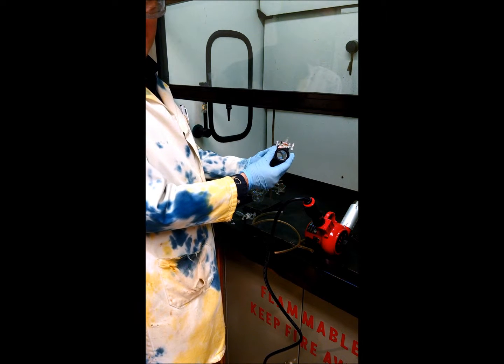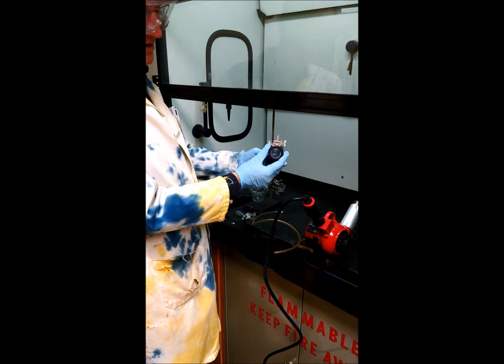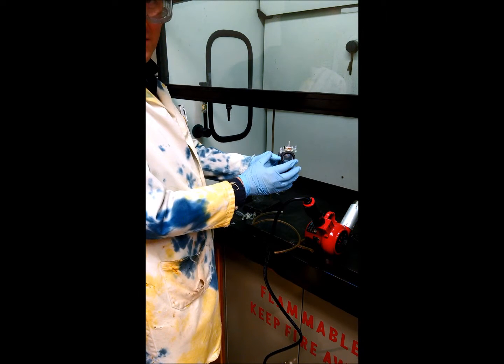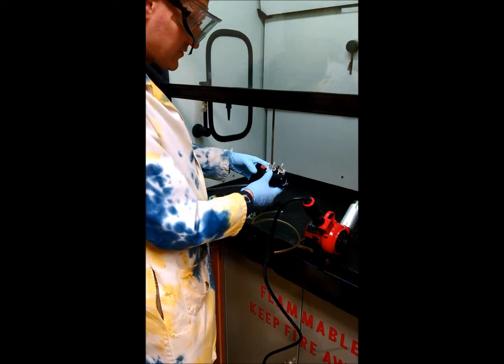The windows are made of sodium chloride. You can see they're highly polished — looks like glass, transparent like glass. But any water or moisture will destroy them, so we need to keep them separate from the water.